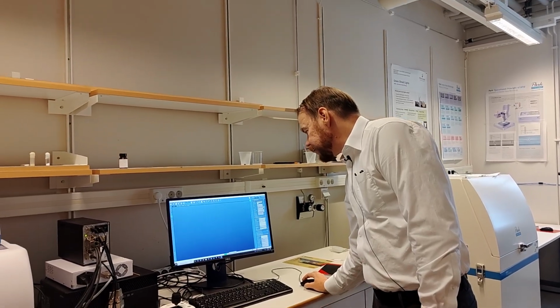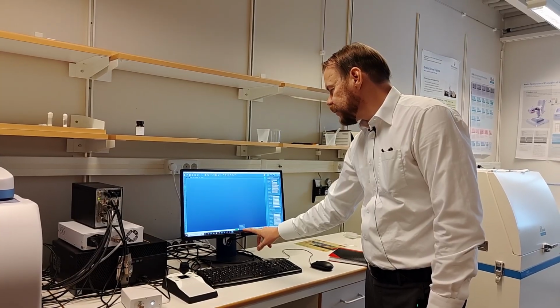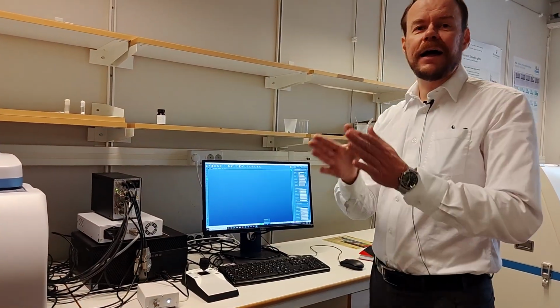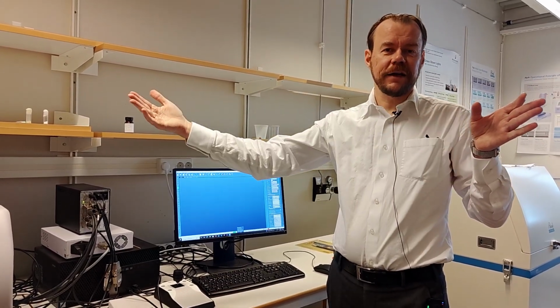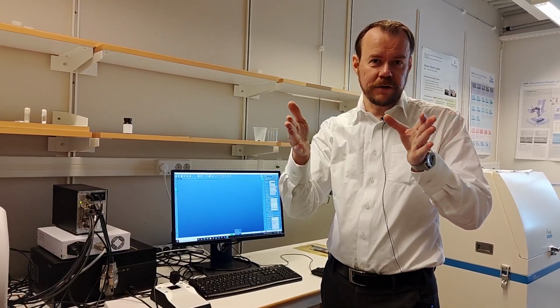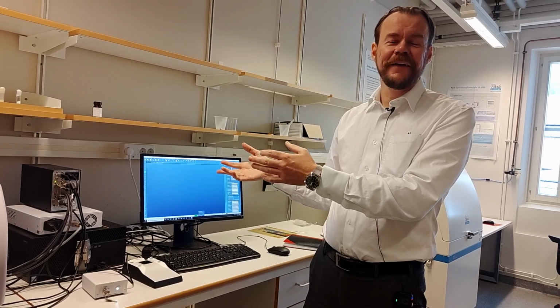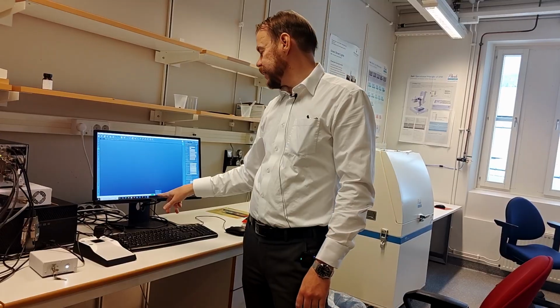So if I click here where it says 1800, I see I have four gratings of the spectrometer: 600, 1200, 1800, 2400. The higher grating you have, the higher resolution you have wavelength-wise in the spectra. But the range, I mean the lowest wavelength and the highest wavelength you can see in the spectra, becomes narrower also. So this is a very classic spectrometer problem. Either you want to see the bird's eye view, the whole spectra, but then the resolution of the peaks becomes worse. Or you want to see just a single peak, and then you can resolve that in more detail by increasing the number on the grating.